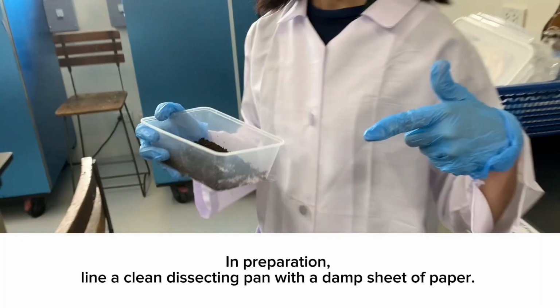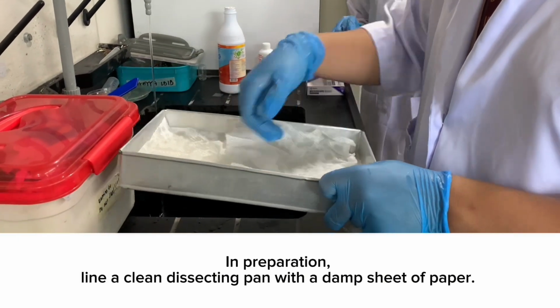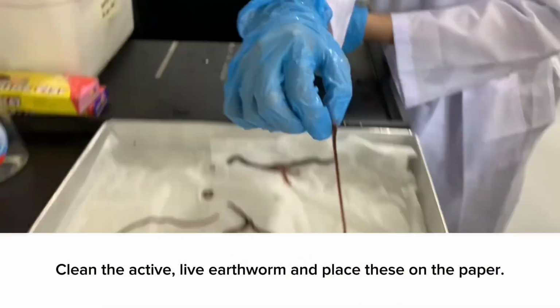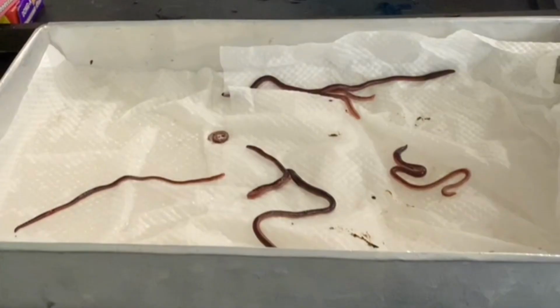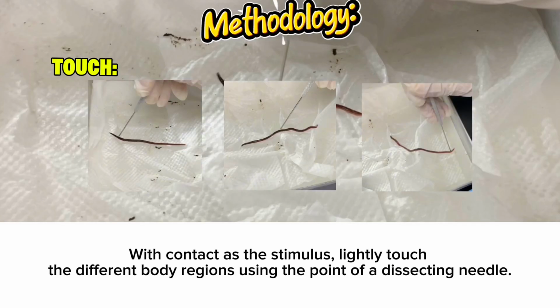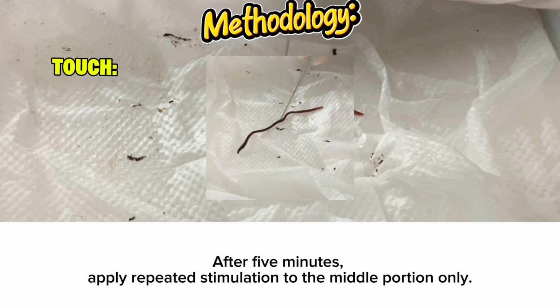Next are the methods. In preparation, line a clean dissecting pan with a damp sheet of paper. Clean the active, live earthworm and place this on the paper. Looks like it can be fried already. Yummy! With contact as the stimulus, lightly touch the different body regions using the point of a dissecting needle. After 5 minutes, apply repeated stimulation to the middle portion only. So basically, you're just tickling it.